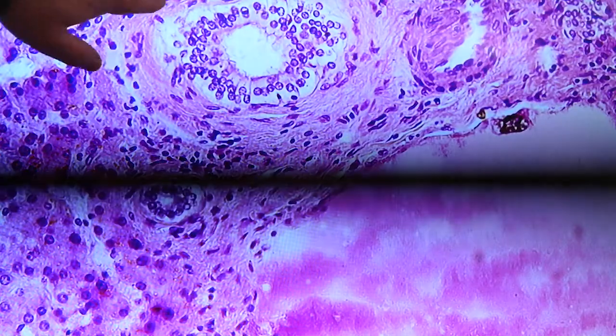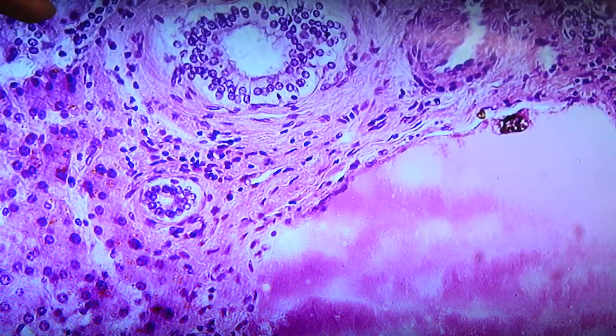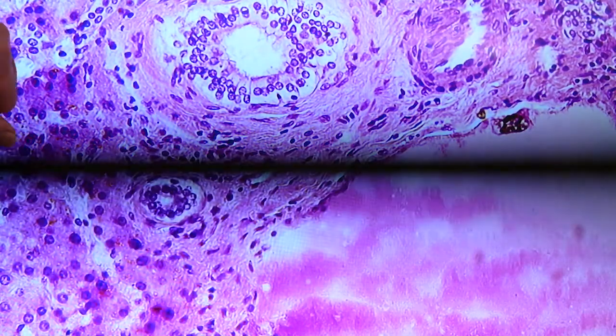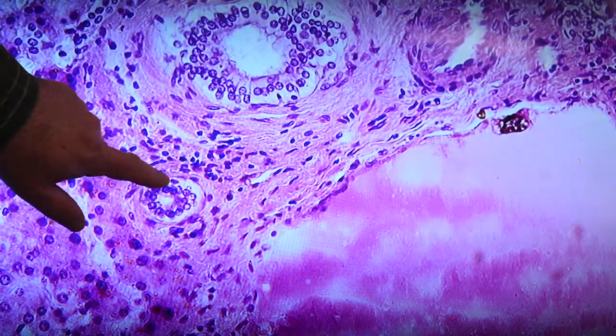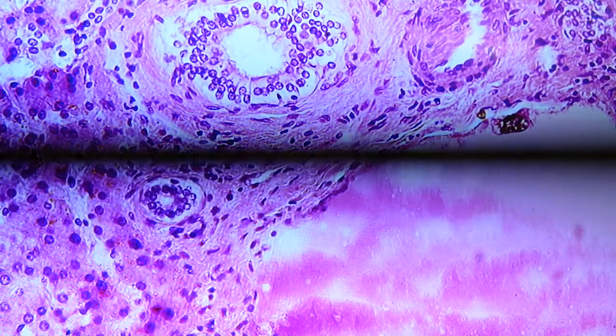Lots of collagen here surrounding this and fibroblasts there. This lighter piece right in here is another one of those small bile ductules surrounded by cuboidal cells. It would be a smaller duct than what this is right here, coming up into this general region of the portal triad.